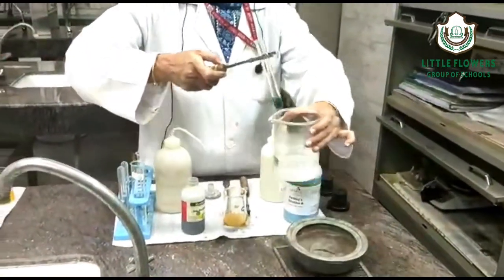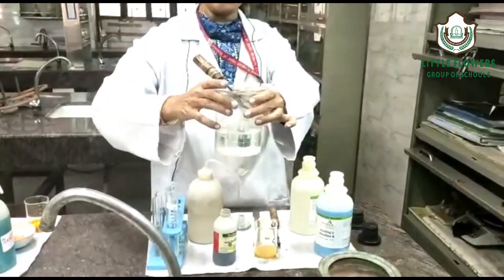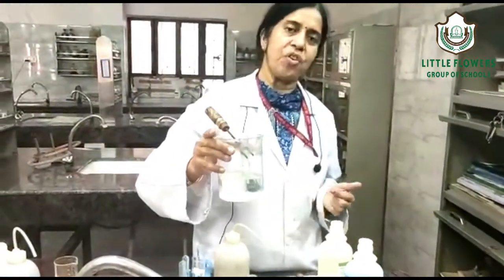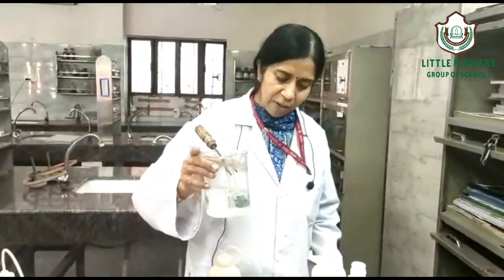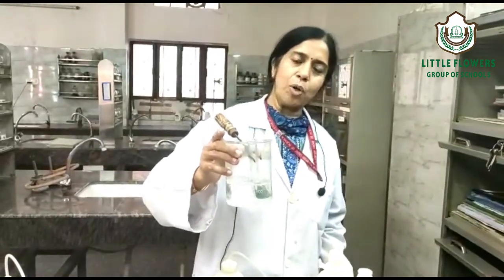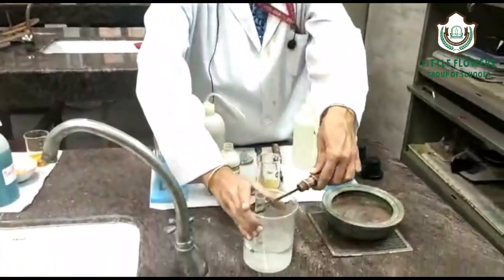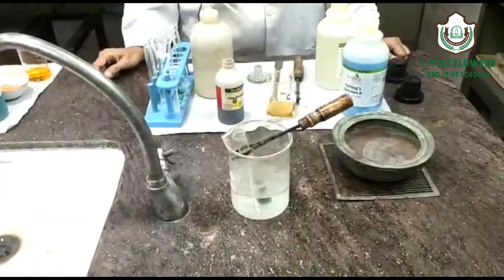We keep this test tube in a preheated water bath for a few minutes, as we need some temperature for the reaction to complete. If an orange-red color appears, it means the aldehyde functional group is present in the given organic compound. Watch — it will be converted into a reddish-orange or brown color.